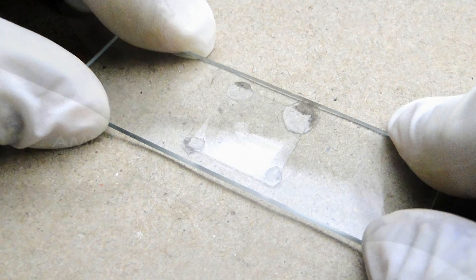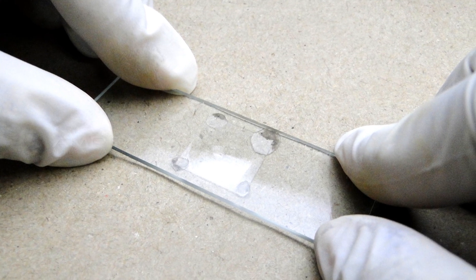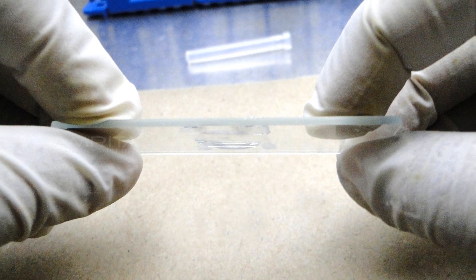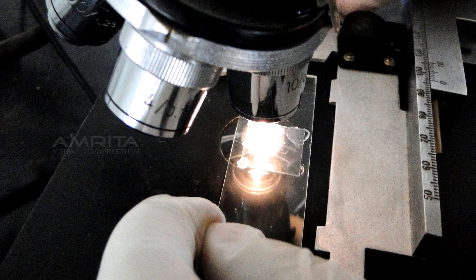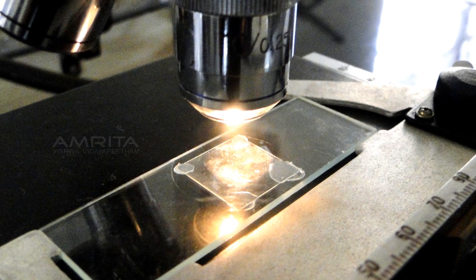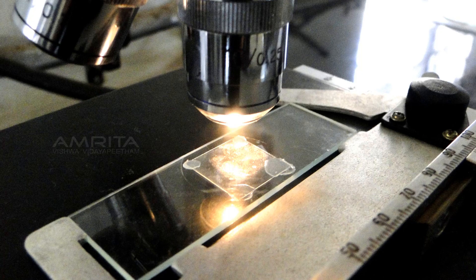Then press gently to form a seal and invert the depression slide. Observe the slide under low power objective and locate the edge of the drop, then switch to high power objective to observe the motile organisms.